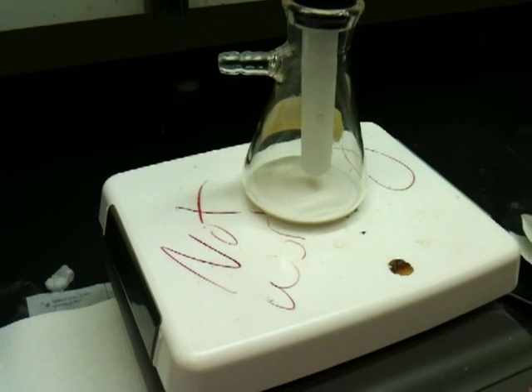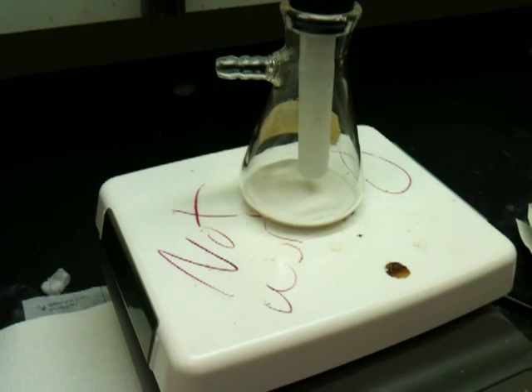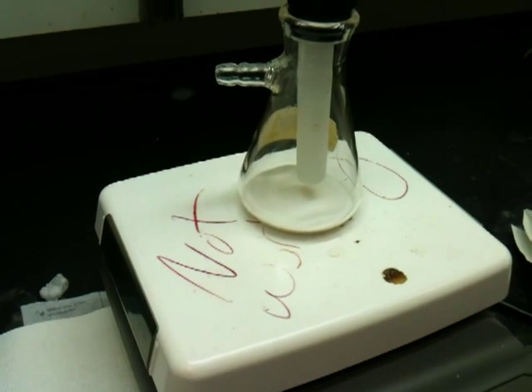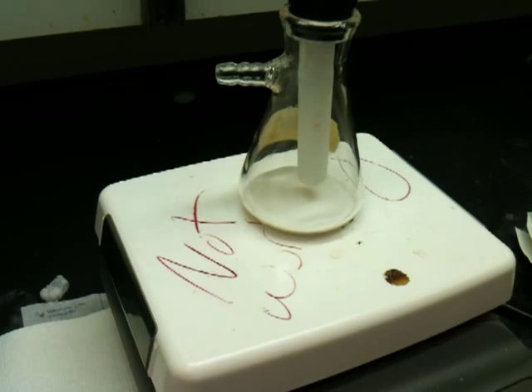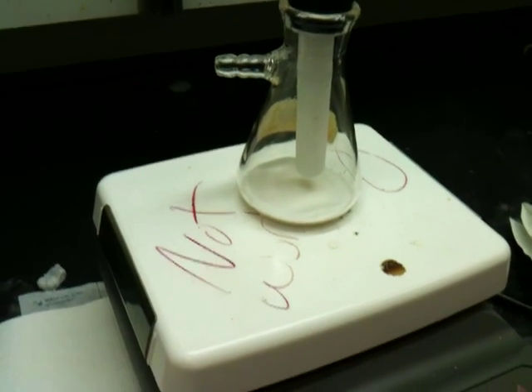It's very exciting and fun. It takes about five to ten minutes to do a sublimation, as long as you have the temperature set right. And of course, even though I'm putting this video up, we're going to help you with this. I'll see you in lab. Bye-bye.